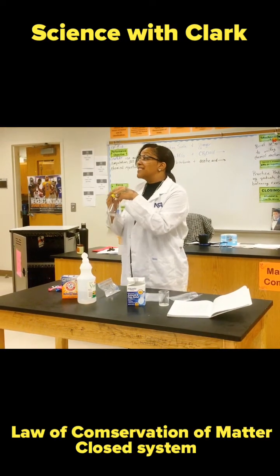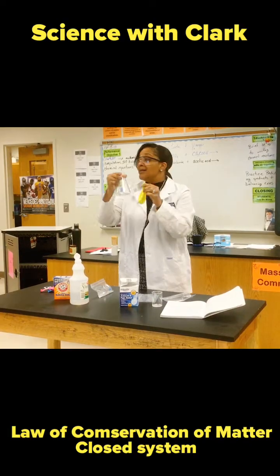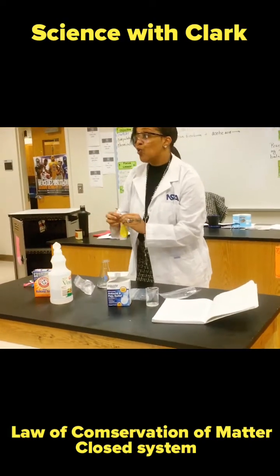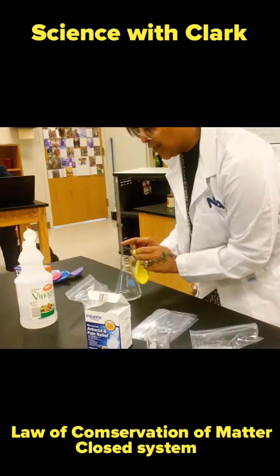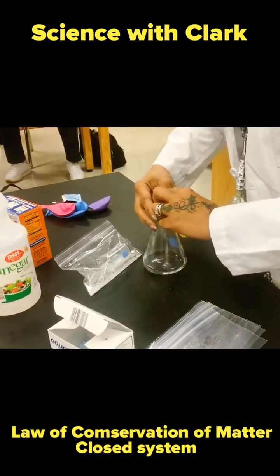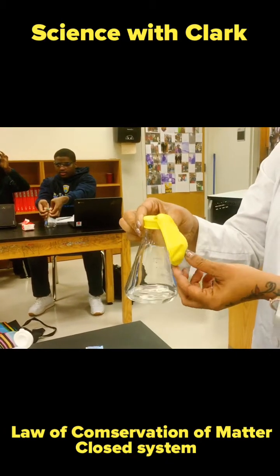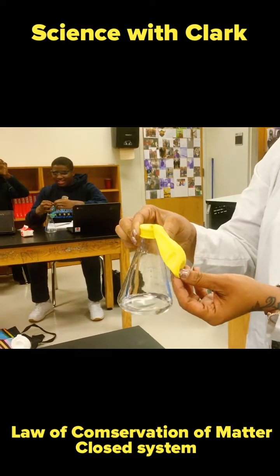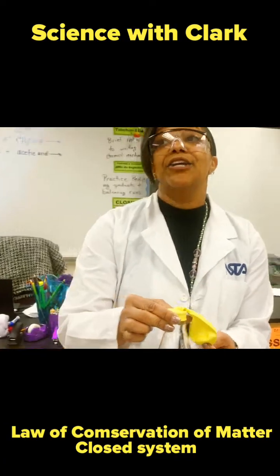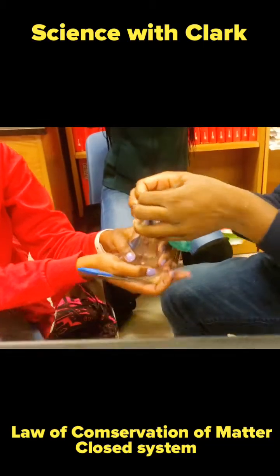You all should already have your effervescent tablet crushed up in the balloon. Be very careful and place the balloon onto the flask that has your vinegar. Is this an open or closed system? Closed. Alright, go ahead now — be careful. You need someone to hold that flask with you.